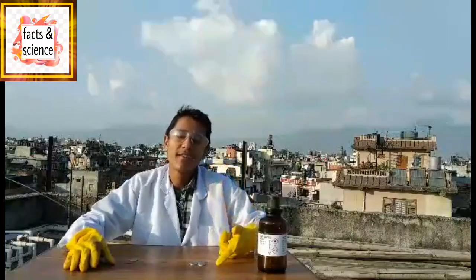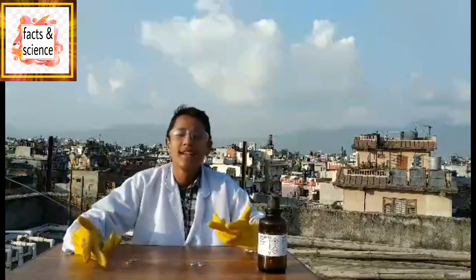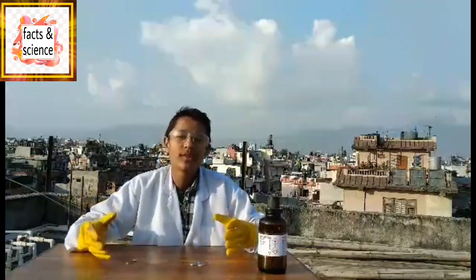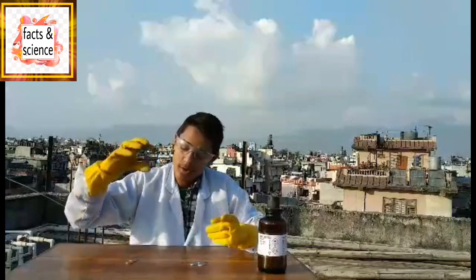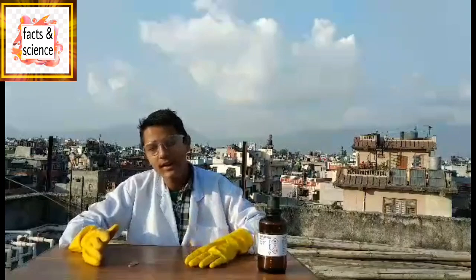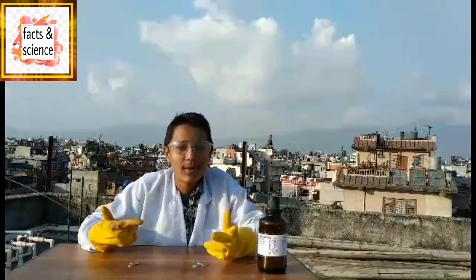Here on my table I have RS1, RS2, and RS5 of Nepal and Indian coins. We are going to do an experiment using both coins — firstly with the Nepali coins, then the Indian coins. Please have a look at my table.